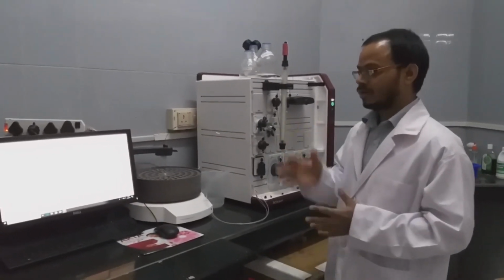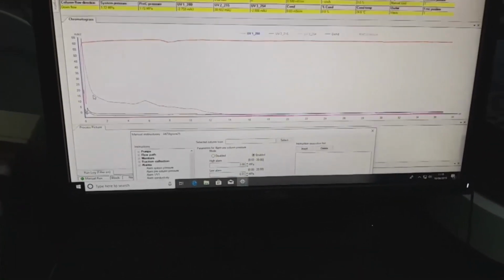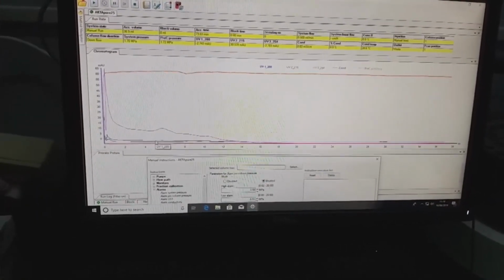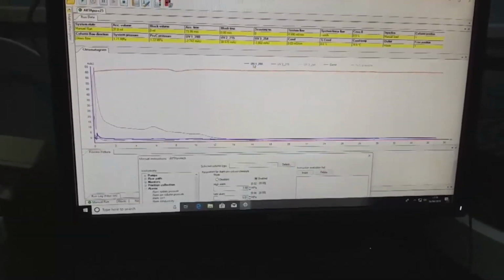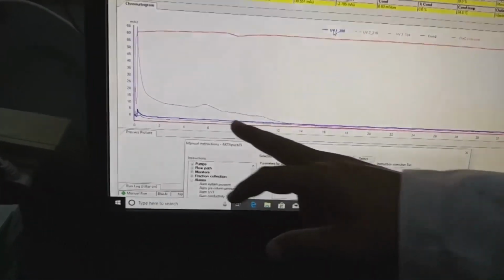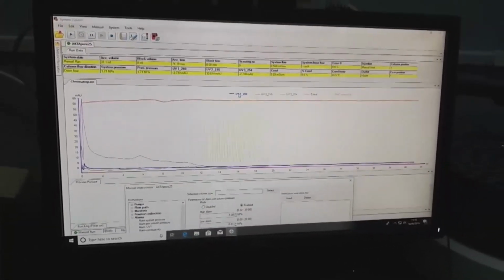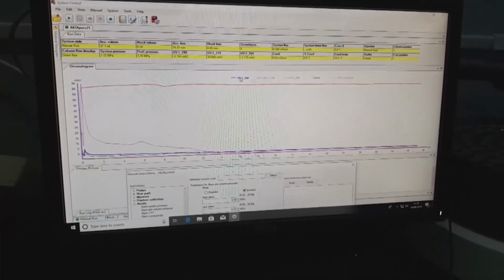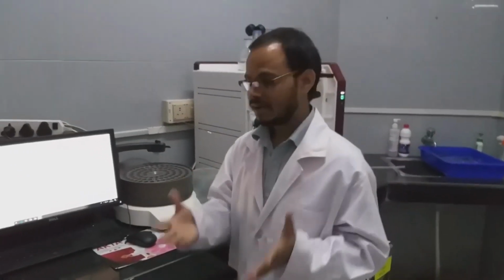This column is equilibrated, as we can see here, after introducing buffer and removing the 20% ethanol and water. The blue line corresponds to 280 nanometers, which is relevant to protein. We can see there is an initial spike, but gradually the curve flattens. That means there are no contaminants, and now the column is ready to inject the protein. We will inject the protein, show how to inject it, and then show the pattern of how they elute.